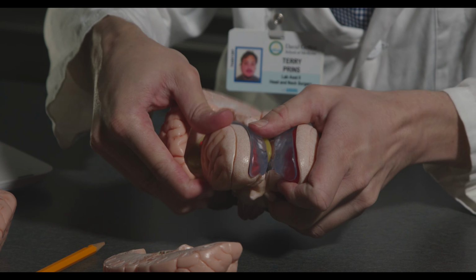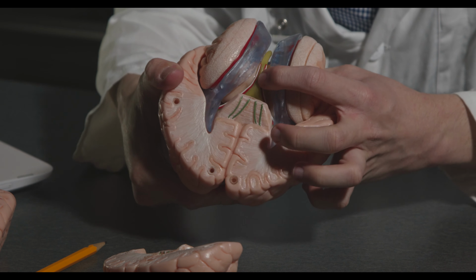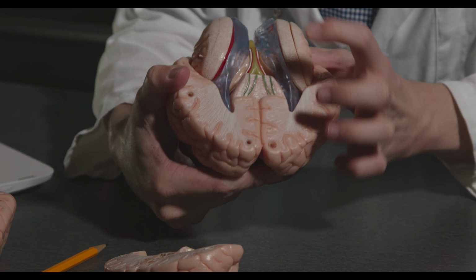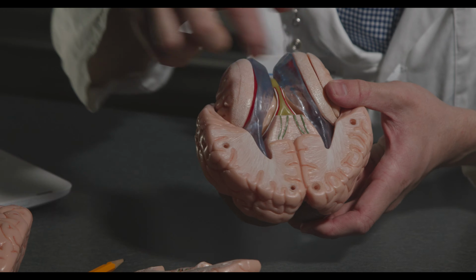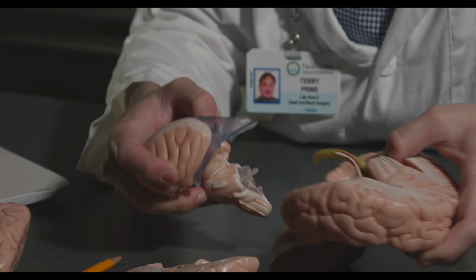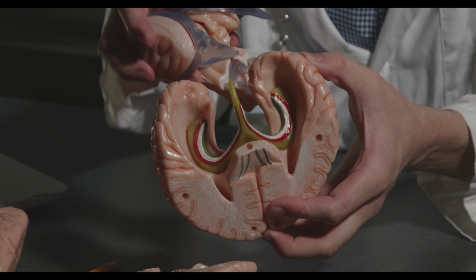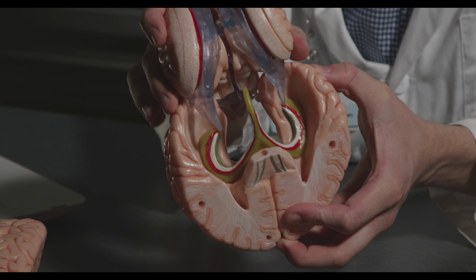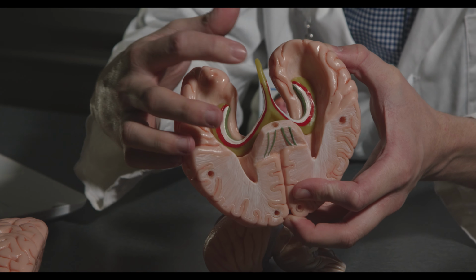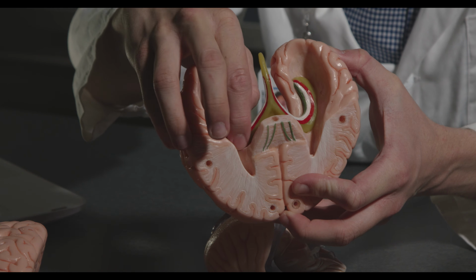So I'm going to remove part of the temporal lobe and the occipital lobe. You can see this green structure here. This is the fornix and part of the hippocampus that's coming over on the other side, which we'll see in a later lab. So I'm going to take this apart here. Here you can see where this was sitting in. So here this is the fornix. It's not labeled in this lab manual, but the hippocampus is, and you can see that here.